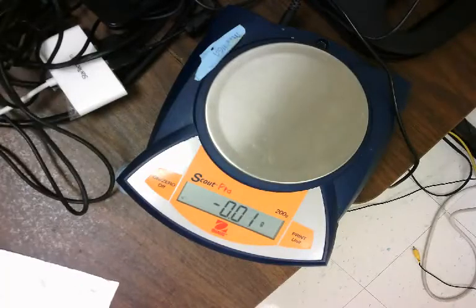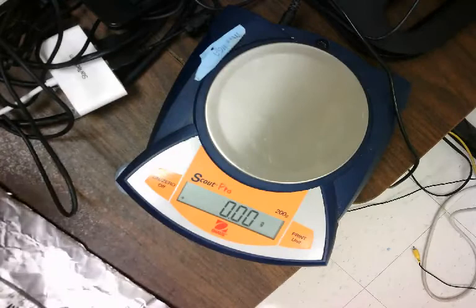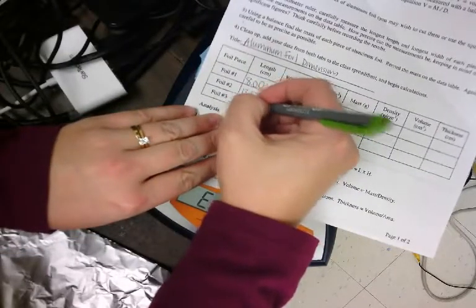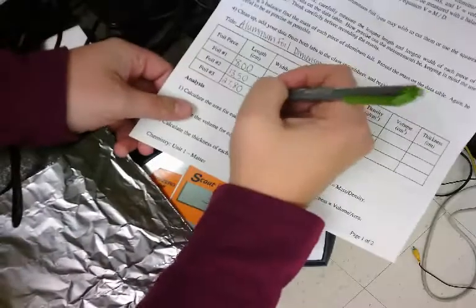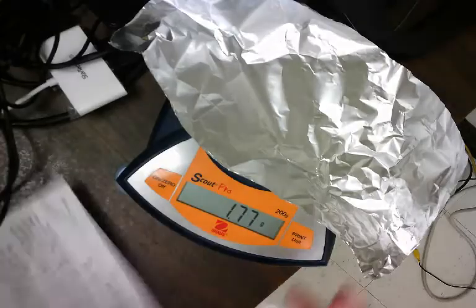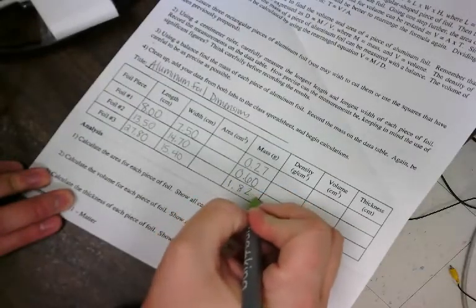Our next and largest piece — pretty big. The length is 27.80 centimeters. Note: 'Error two' on the balance means I put too much weight on it — I should not press on it. The width looks like 15.40 centimeters. And now for the mass: 1.82 grams.